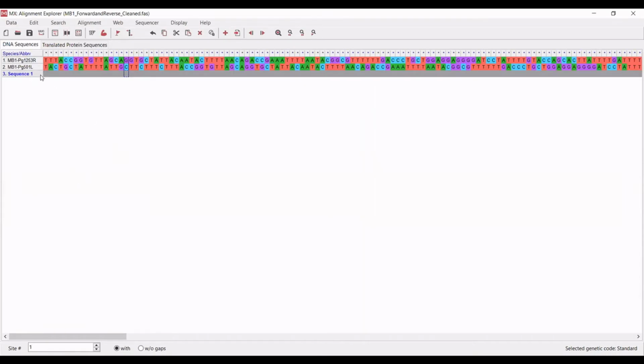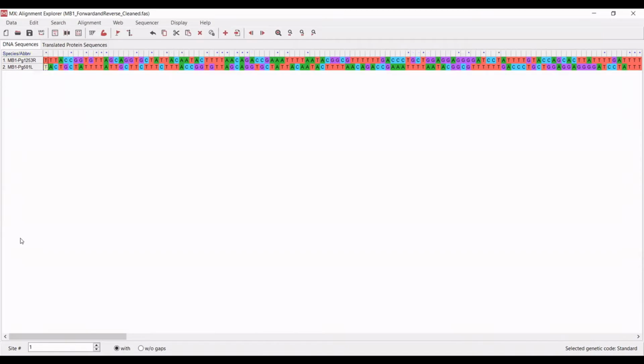I'm also going to select this blank default sequence that opens because there always has to be at least one sequence in the file. I'm just going to delete that one. But we have our two edited sequences here. And so it's important to keep in mind that the reverse sequence has already been reverse complemented. So we don't have to do anything with that. So in order to align the sequences, you're going to go to the top here under alignment, and you're going to select what alignment program you want to run.